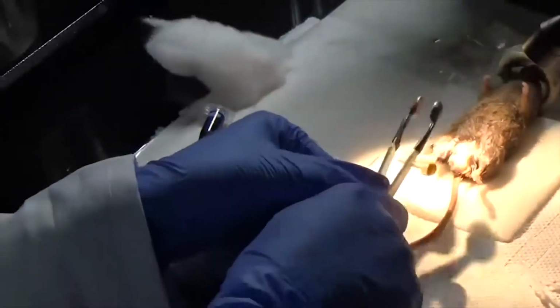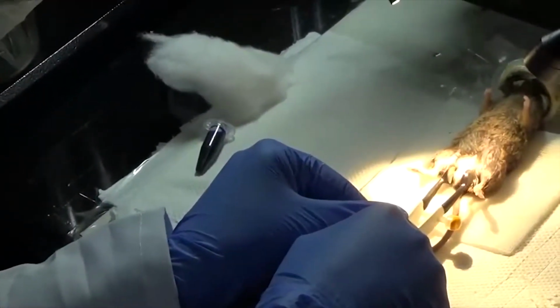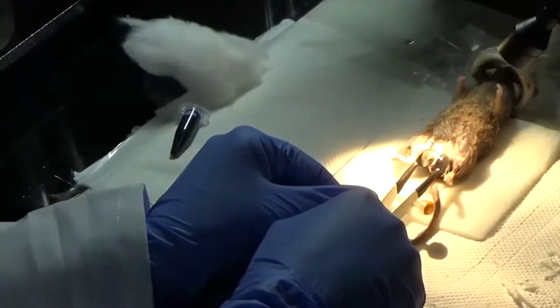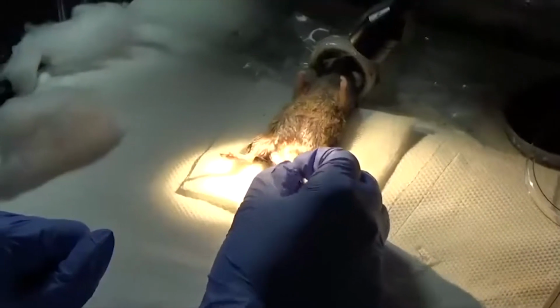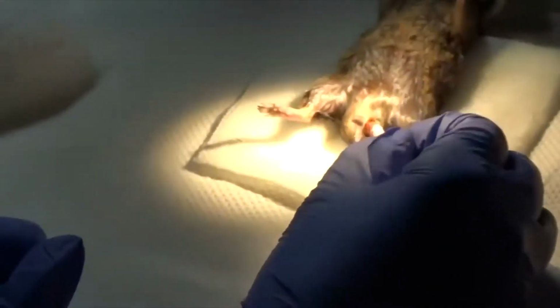So we keep the testes in between electrodes, and then we give pulses, 4 forward pulses and 4 reverse. Finally, we apply povidone iodine solution to the testes, so that any damage that has happened with the syringe should not let anything enter inside.